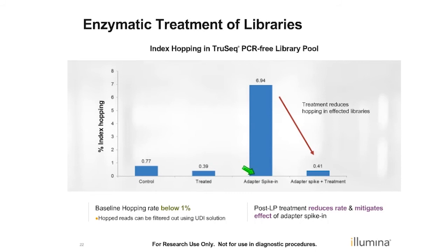If you add adapter, just like we've shown in the spike-ins, if we spike in adapter to very high levels, we can induce very high levels of index hopping, up to 7% total hopping across all the combinations. And then by using this treatment, we can again knock this back down to essentially control levels with enzymatic treatment.